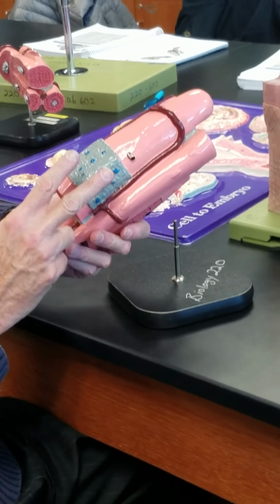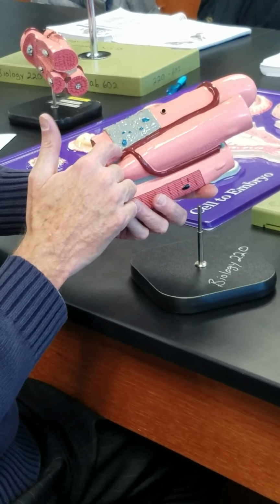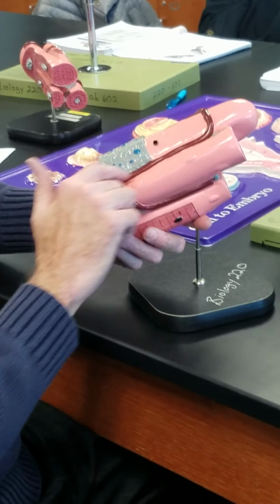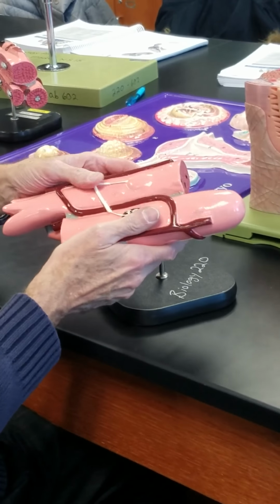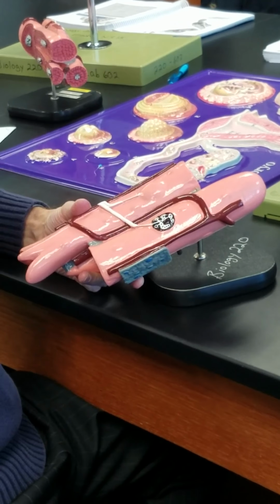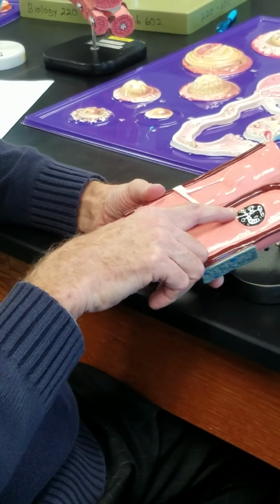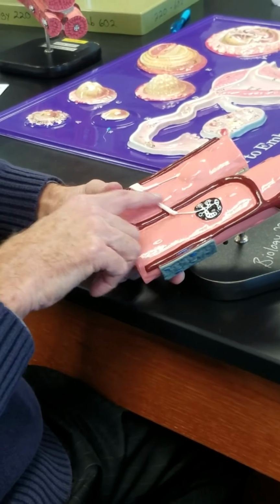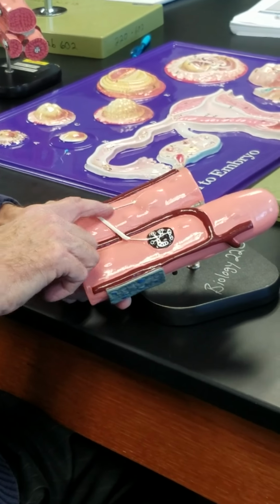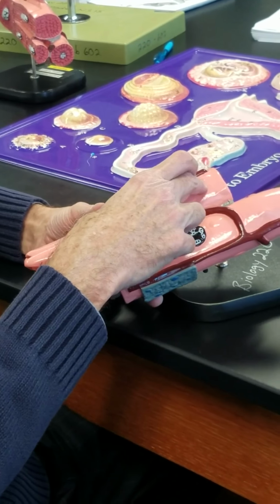So we have the endomysium connective tissue surrounding individual cells and running in between individual cells, and yes, we see the nuclei of the connective tissue cells. Capillaries running through the endomysium here, and here we have one axon collateral of a somatic efferent motor neuron going to this skeletal muscle cell, and another axon collateral of the very same neuron going to this skeletal muscle cell.